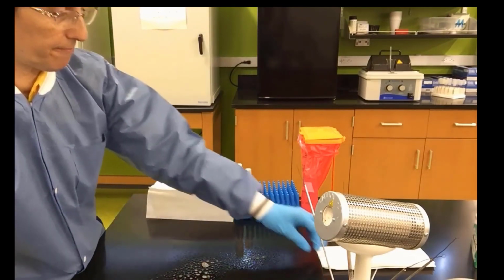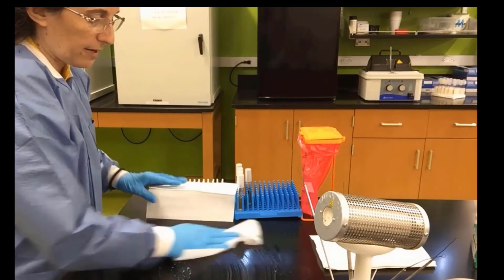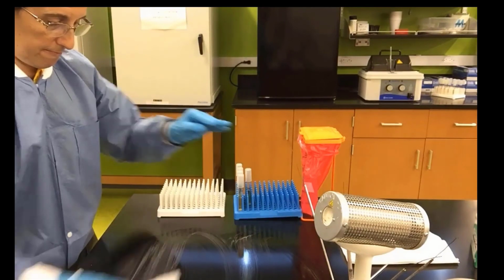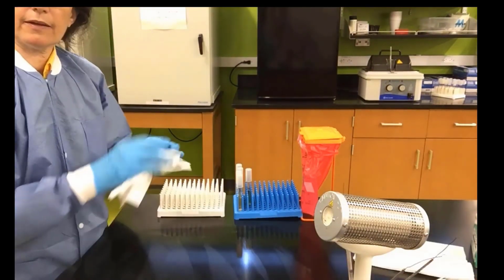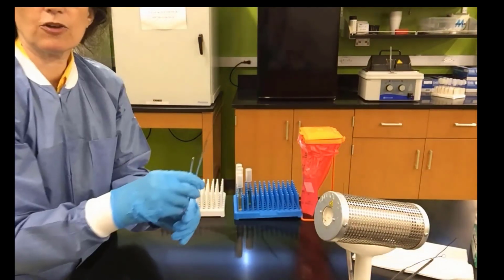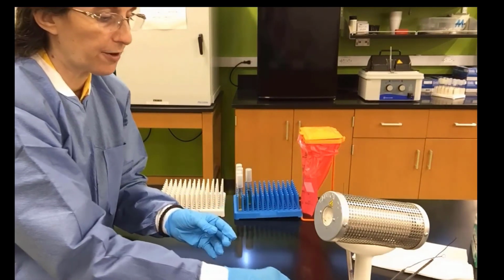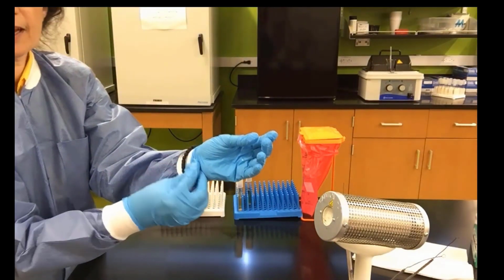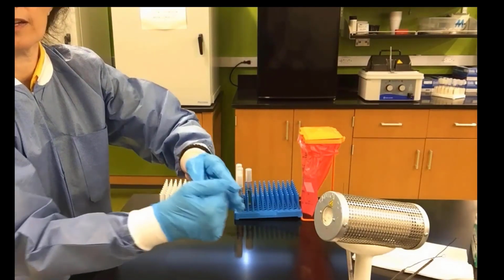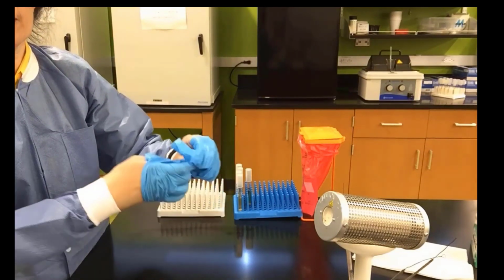We put plenty of bleach on our table and use paper towels to disinfect our area. Very important to clean the lab when we are done. We can throw this in the trash can since it does not have bacteria on it. Our loops and needles need to be disinfected. Anything that was contaminated, if it was your gloves or paper towels that had bacteria, you need to throw them in the hazard trash. Make sure you take off your gloves as shown here.